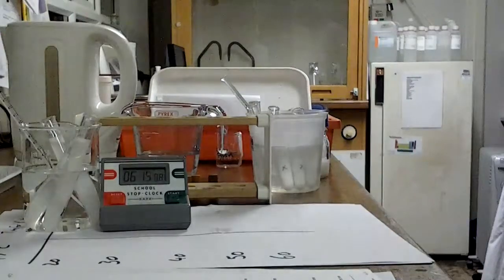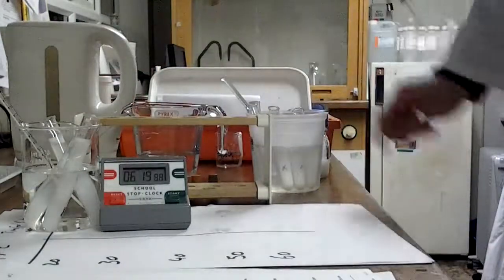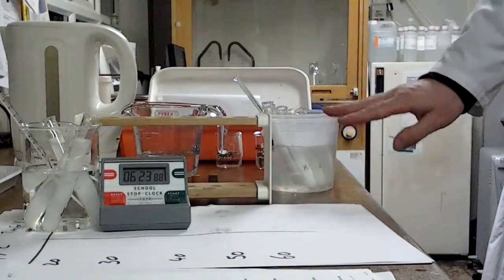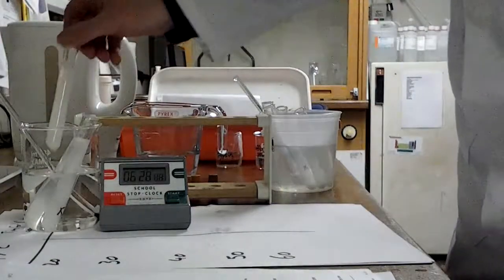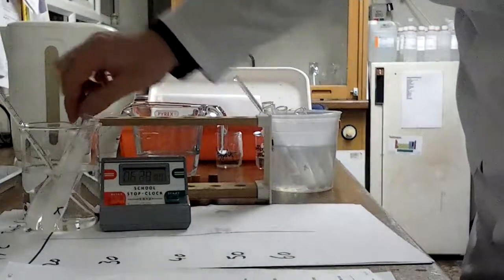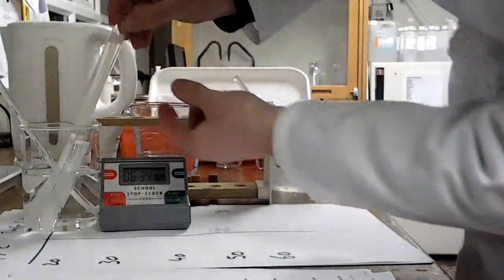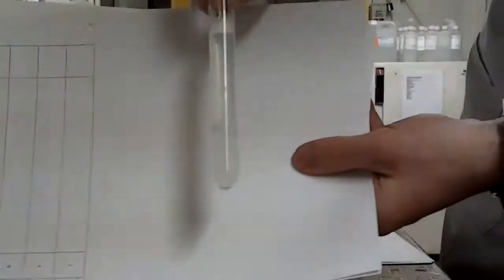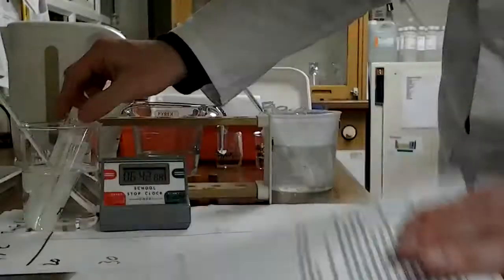Okay, it has been a few minutes. In that time, I was keeping one eye on this. I actually managed to set up my next experiment, so this is now at 30 degrees in the water bath, equilibrating. But I've just cast my eye back this way, and I think if you start looking closely, you can in fact see an X through the milk. It has gone clear enough that I can now signal that as the end point.